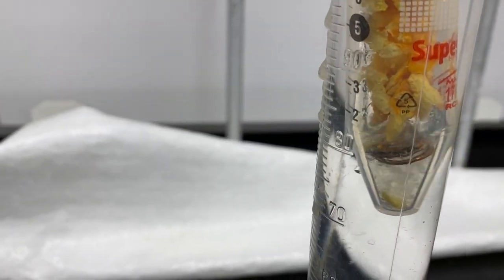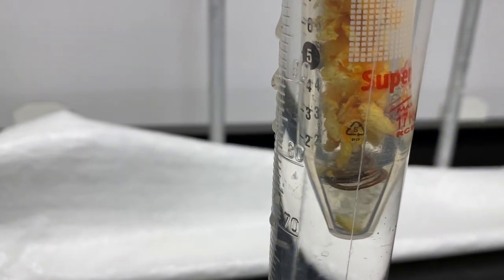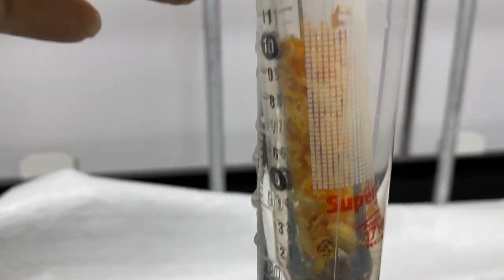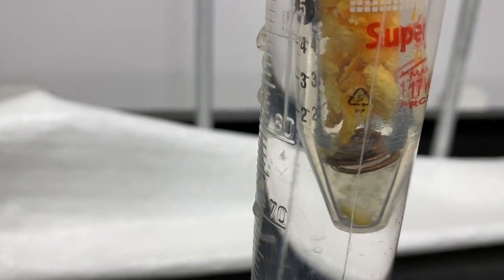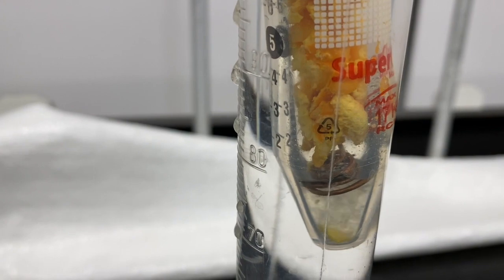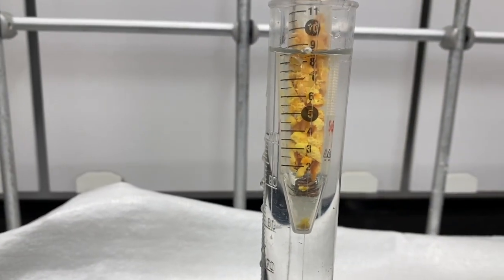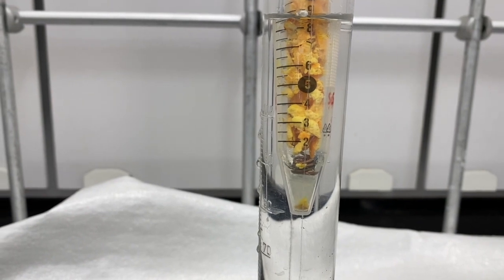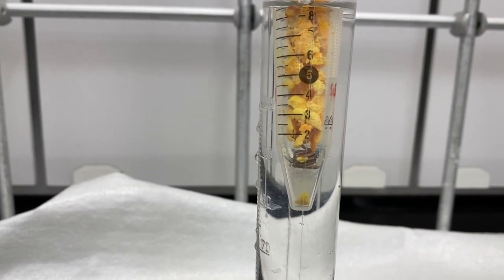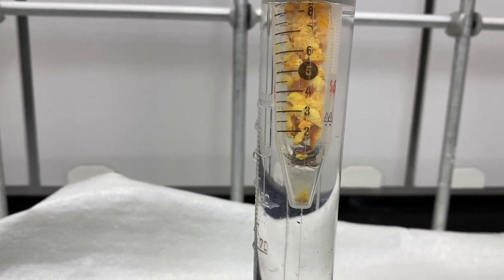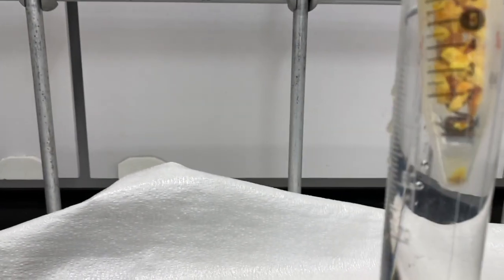This is what we want to see. That supercritical CO2 is able to pass through all of the orange rind and travel down to the bottom of the centrifuge tube. That way the oil that comes out will be able to reside in the very bottom. There is a little piece of orange rind that passed through and we'll get that out later.